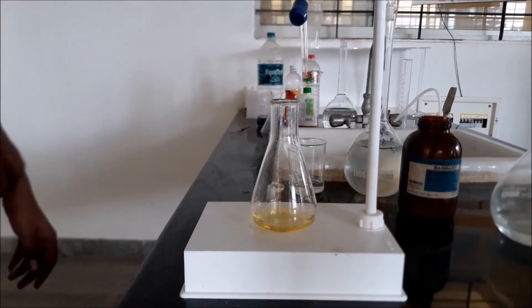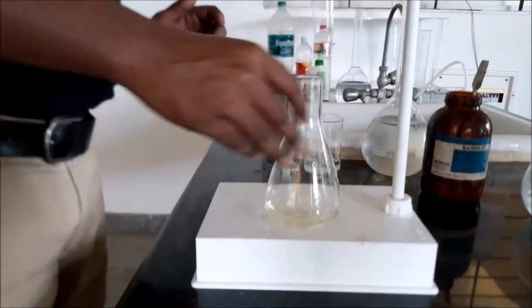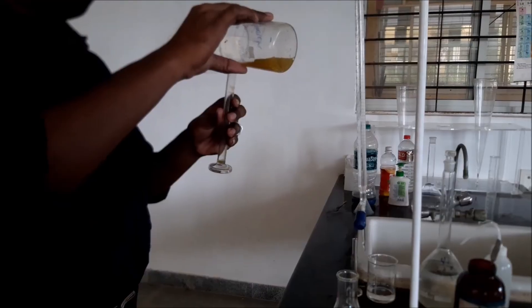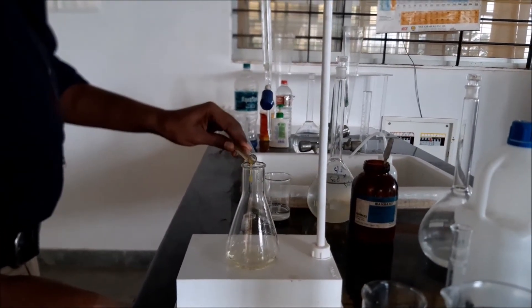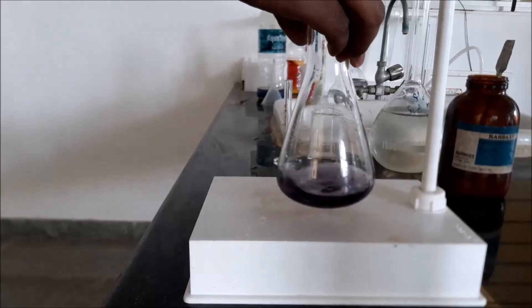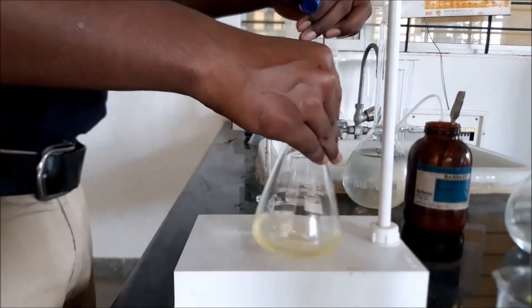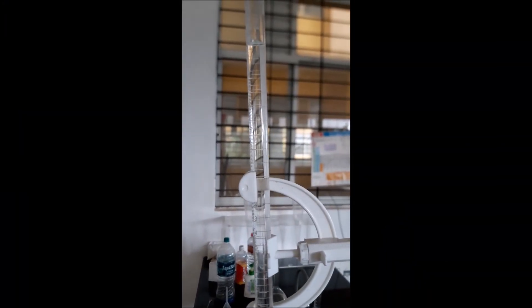Titrate the yellow solution against standard sodium thiosulfate solution until you get a pale yellow color. The dark yellow color has faded to pale yellow. Now add 1 ml of starch solution. After adding starch, the solution changes to a dark blue color. Continue titrating against sodium thiosulfate until the dark blue color vanishes. Note down the burette reading for the calculation of residual chlorine.